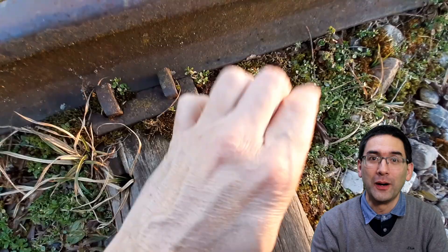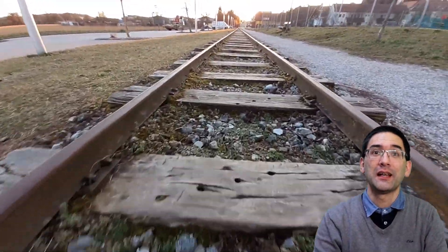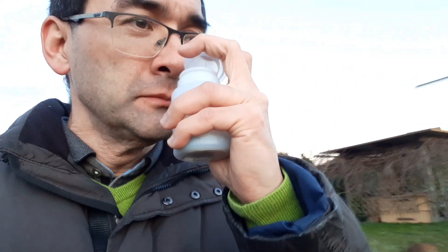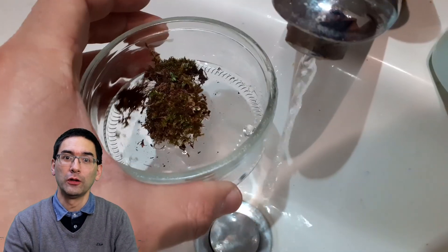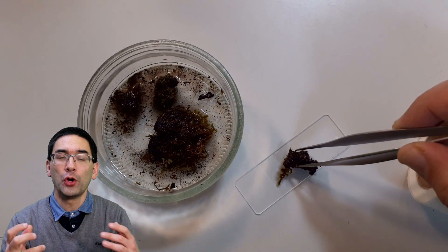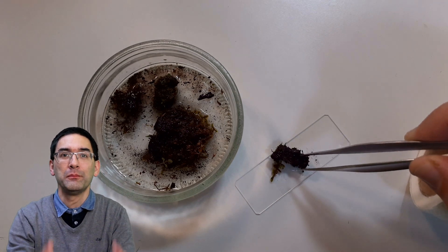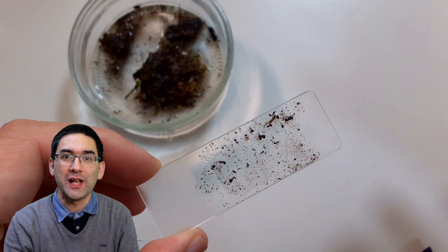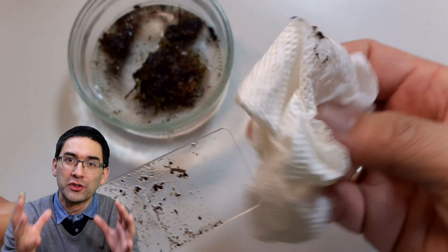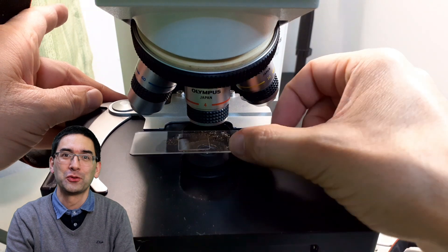I'm going to show you now how I prepared the specimen and how I found the worms and little insects. There was peppermint chewing gum in the container that smells strongly like peppermint, and I hope the fumes do not kill off any microorganisms. I first took all the moss out and added a little bit of water since the moss was dry. Then I tapped the moss directly on a microscope slide, hoping to wash out some microorganisms. I put on a cover glass and used tissue paper to remove all the excess water.